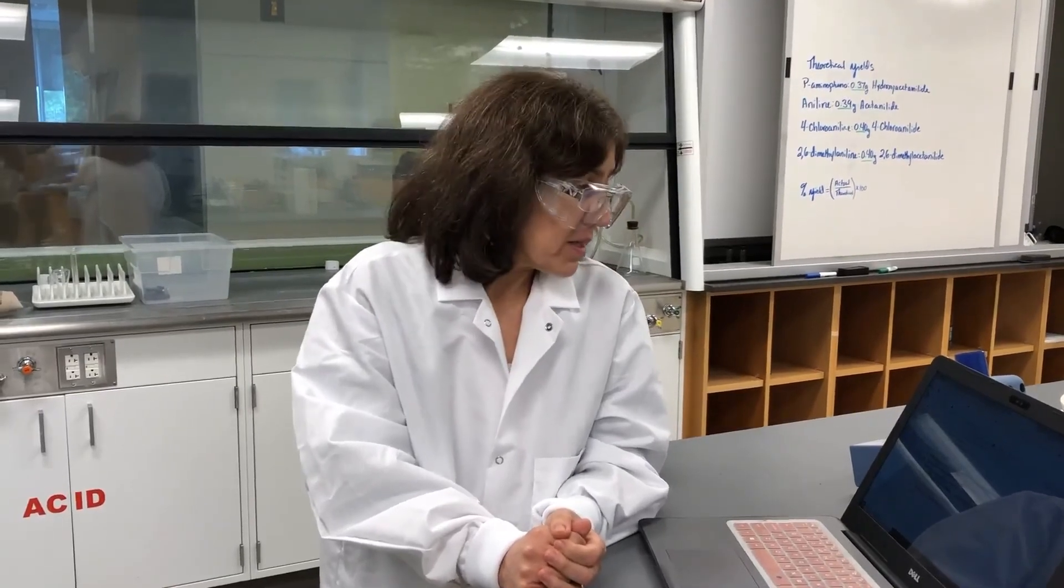Wear gloves and safety glasses. Some tips about sep funnels. So the sep funnel has a top to it, but the top has to be matched to the sep funnel. You can't interchange tops. So make sure you have the right fitting top on the sep funnel.